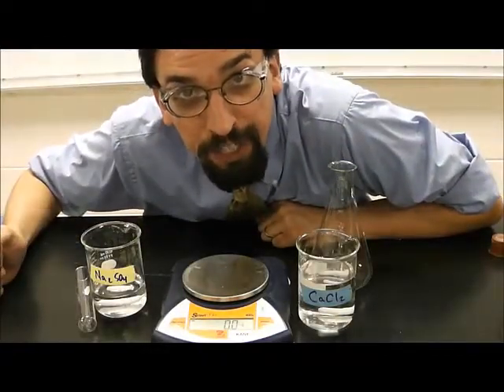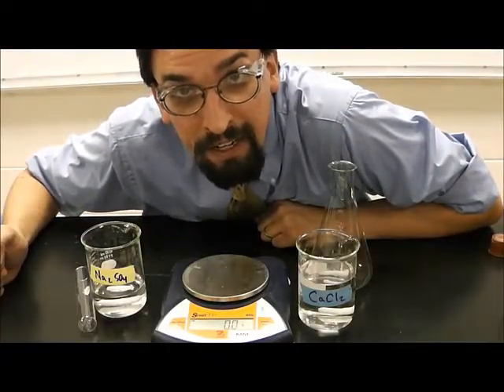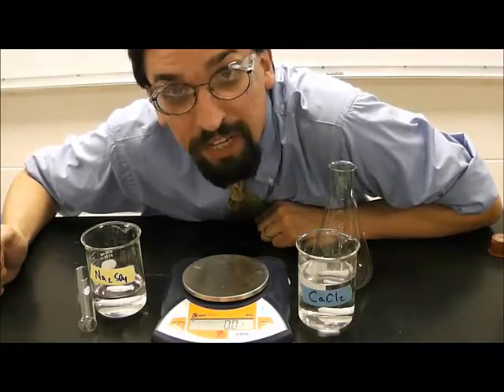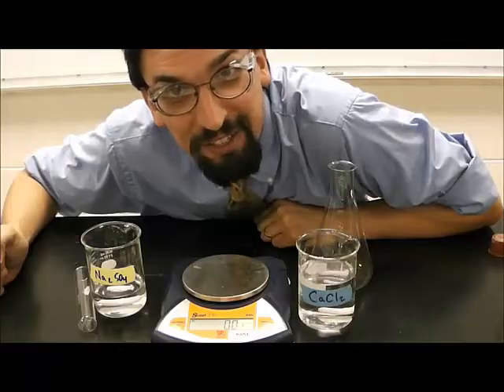Hi guys, Mr. Cain here for a quick chemistry demonstration. This is going to be a law of conservation of mass or a law of conservation of matter, depending on which way you like to talk about it.